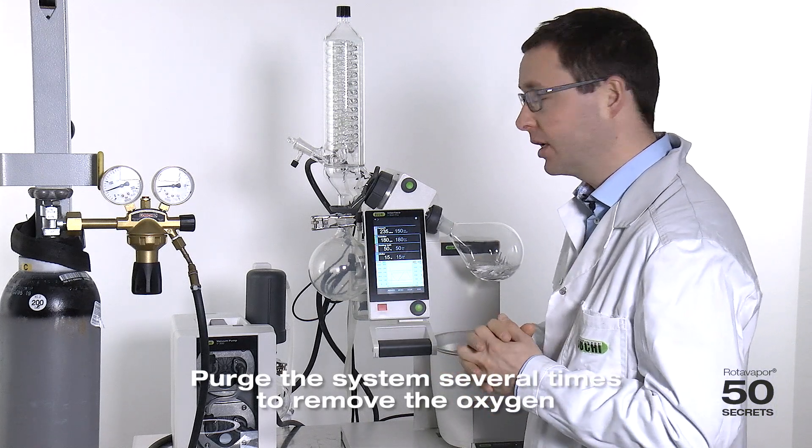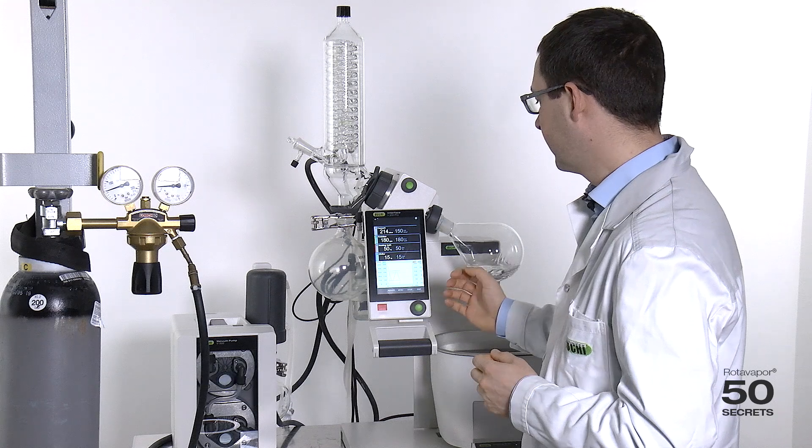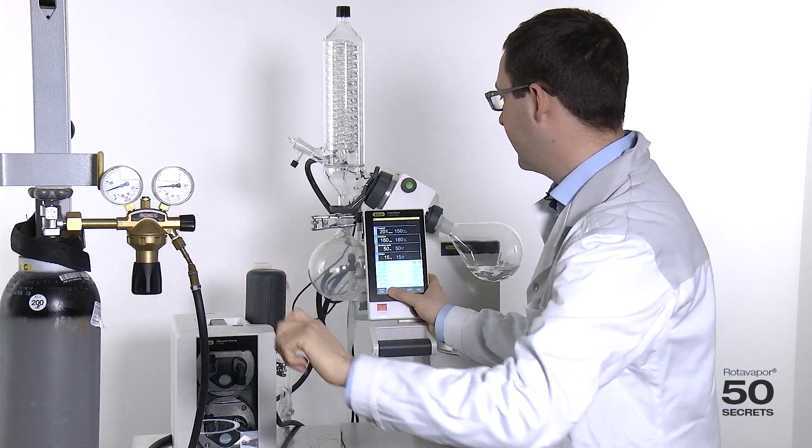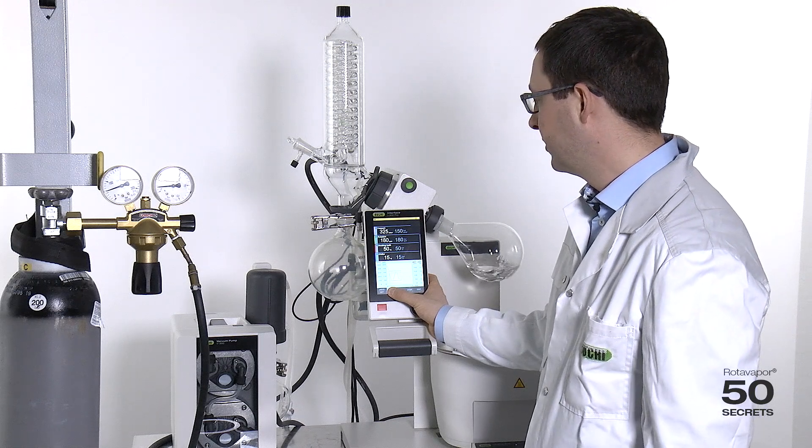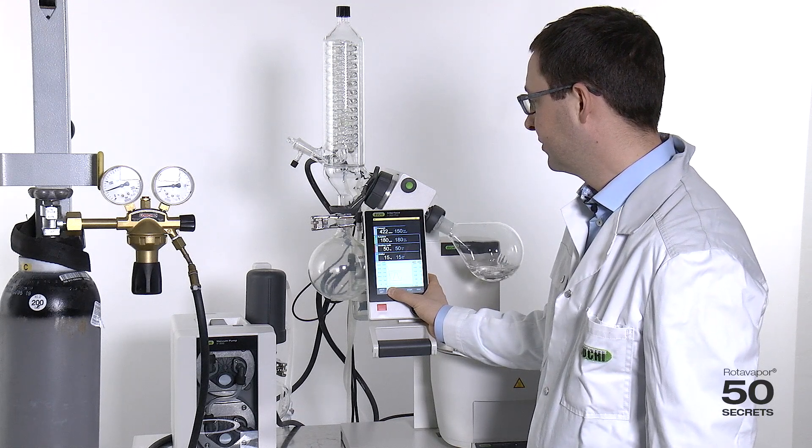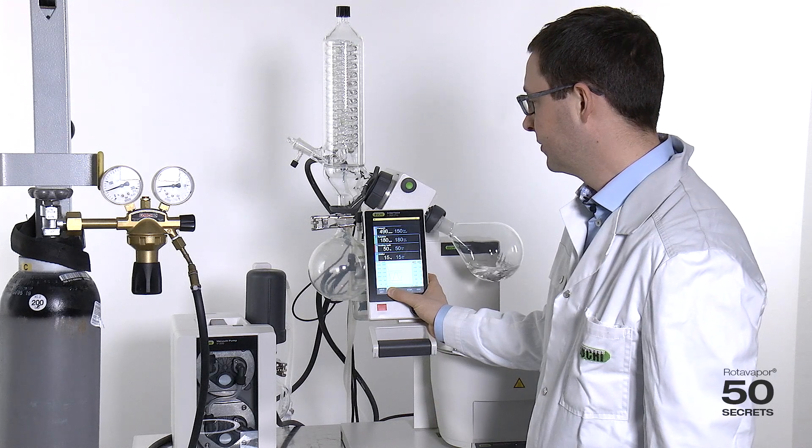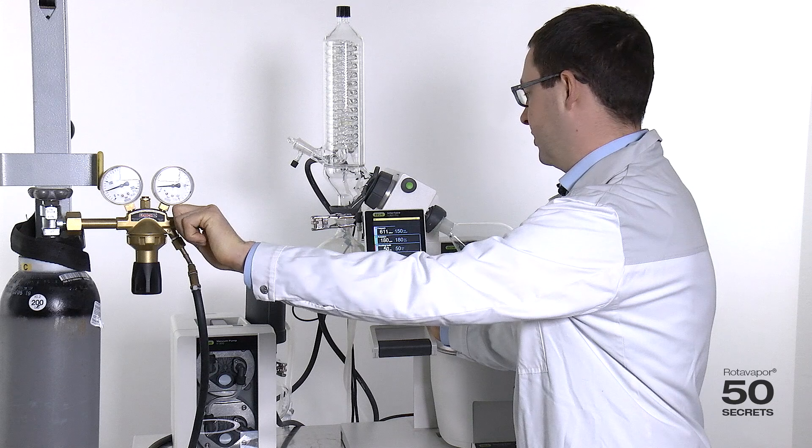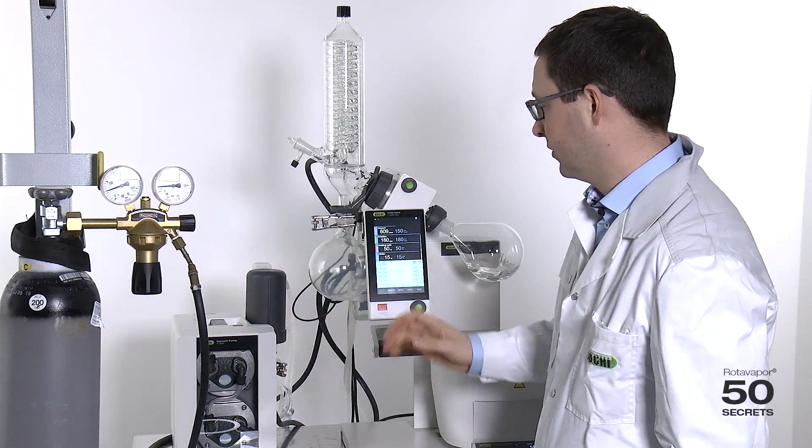I will do it the second time. I open the valve. I press aerate. I stop and I close the valve. Hold off.